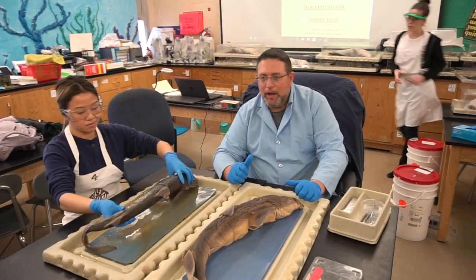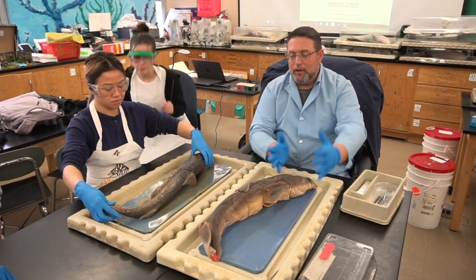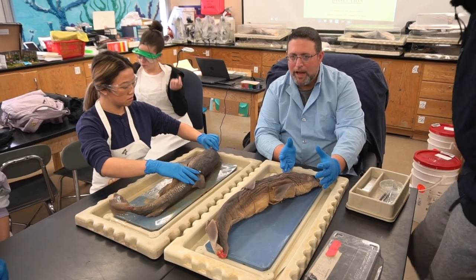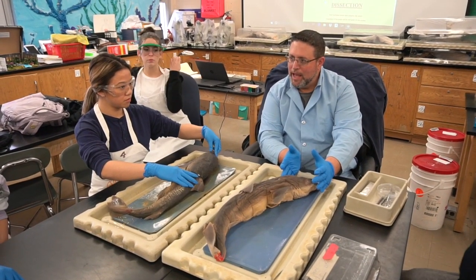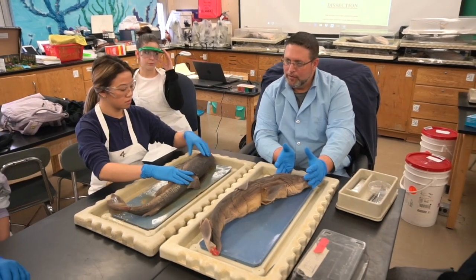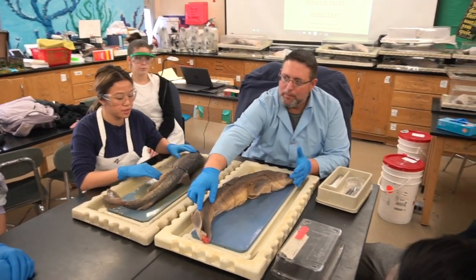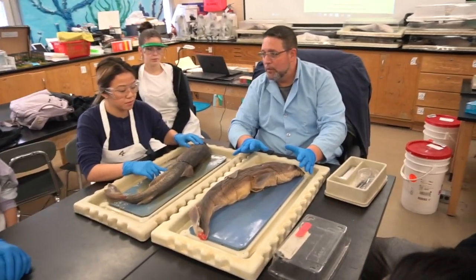As a reminder, we have to know our anatomical terminology. Okay, positions. Towards the head of the animal is called what? What's the vocabulary word that means the front of the animal here? The A word. Anterior. All right, anterior of the animal, versus the opposite, which is posterior. What are the additional terms that we talked about?